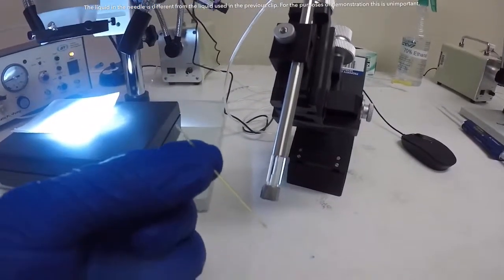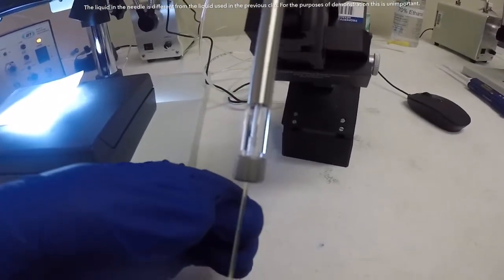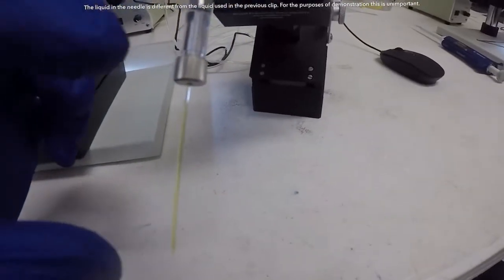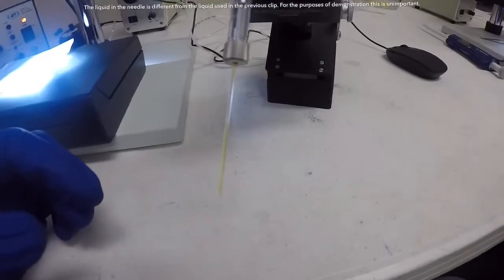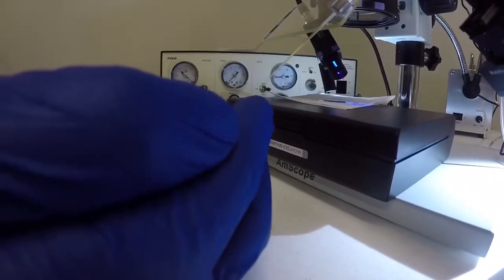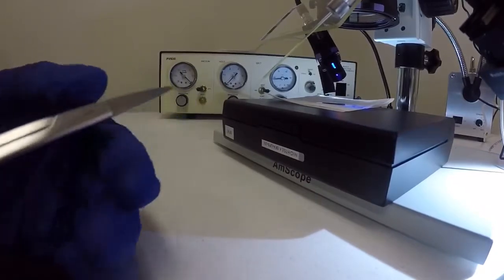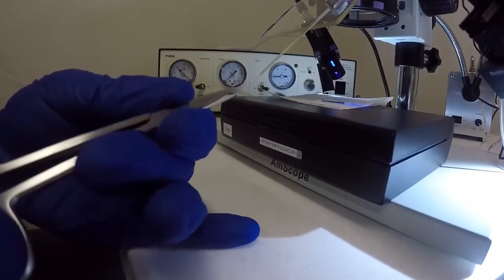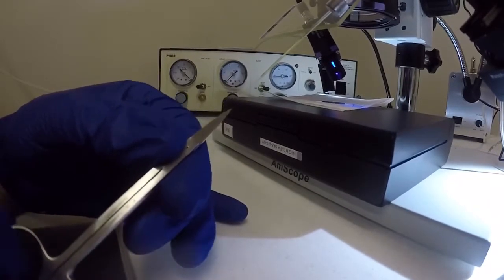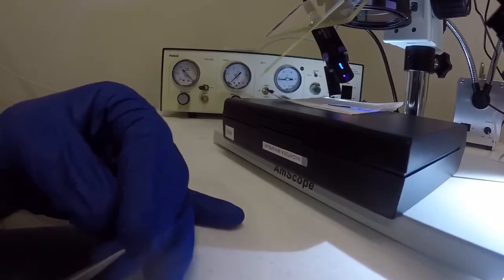Your next step is you're going to insert your needle into the micro-adjustment mechanism. So you just have the end of your needle there and you just slide it right on up in. You don't want to just shove the whole thing up in there, but that length is probably just fine where you have about an inch and a half, two inches of your needle still protruding. So when these needles are pulled, most of the time they don't have a hole in the very end of the needle. So you have to manually trim a hole or trim the needle tip until a hole becomes available or apparent. You have to do it very slowly and very carefully because it's really easy to trim too far and then the hole in the end of the needle is too big. It's better to not trim far enough and then to adjust it again than to trim too far and have to get a whole new needle.